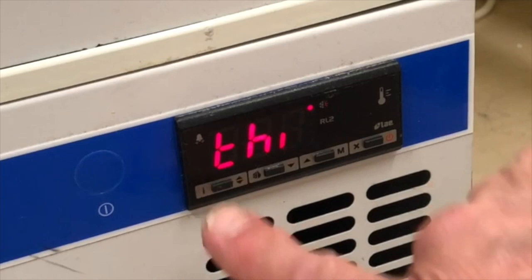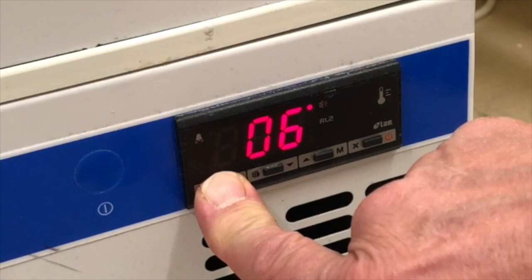Release the button and TLO will appear. Press and hold this button again to display the minimum temperature. Record the number.